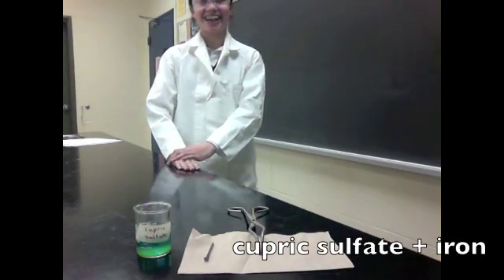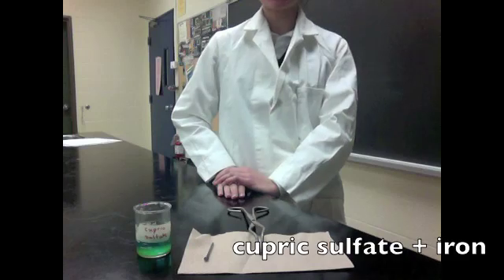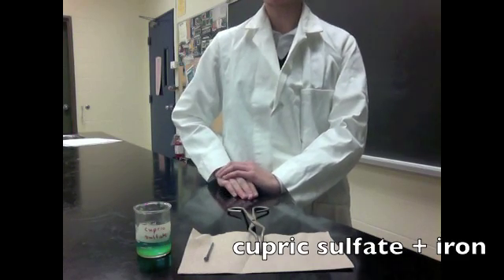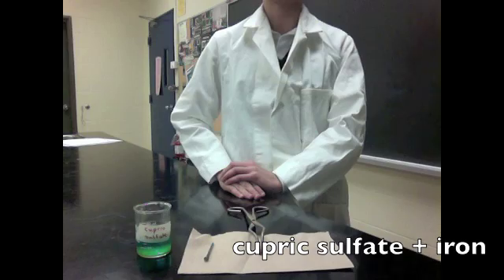Hi class, my name is Danielle and today I'm going to be conducting an experiment called the cupric sulfate and iron experiment.